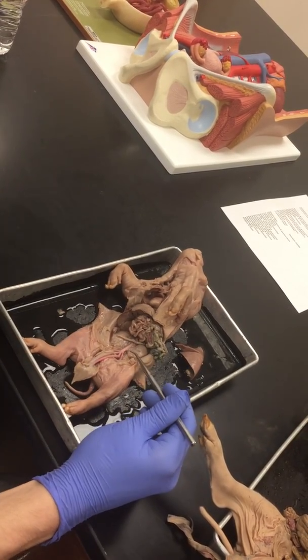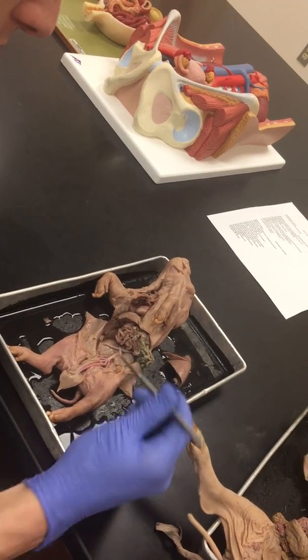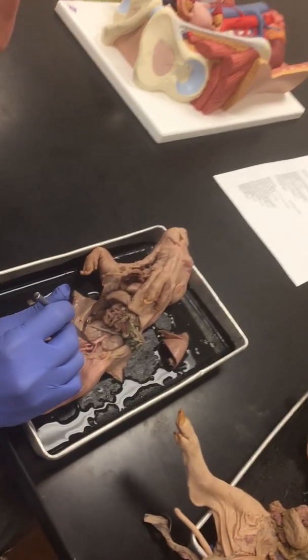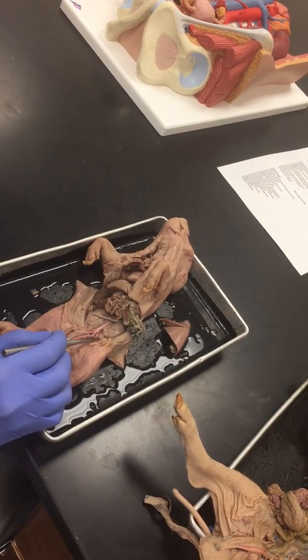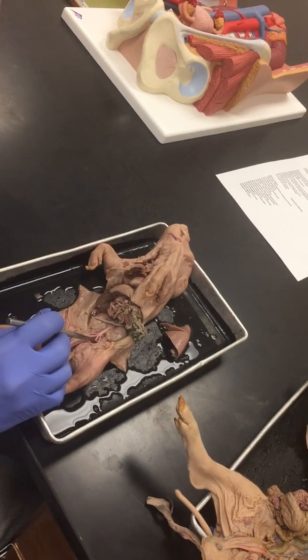So they don't really have an internal iliac now, so it's kind of different as far as what we learned before. So the common iliac artery is going to be there. So this first little branch is the common iliac artery when I'm lifting up. And then once we get to this little branching, after that, we're going to have the external iliac.